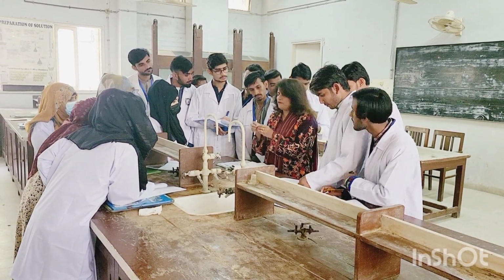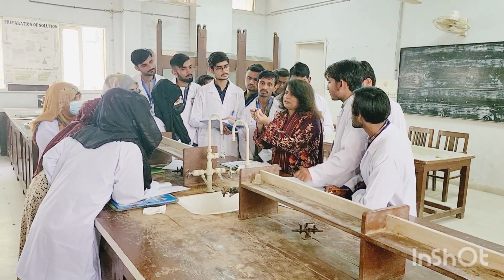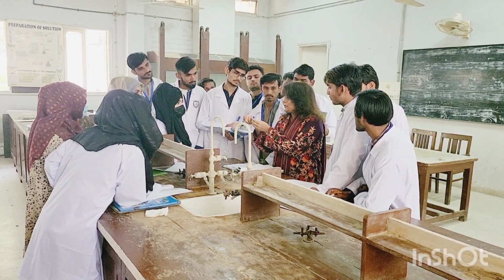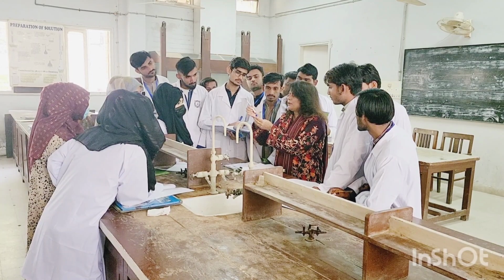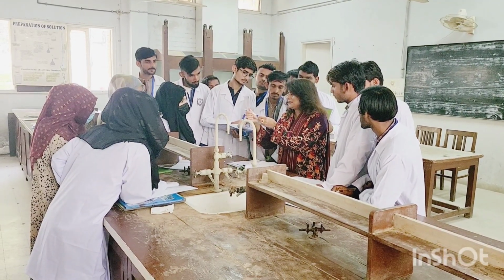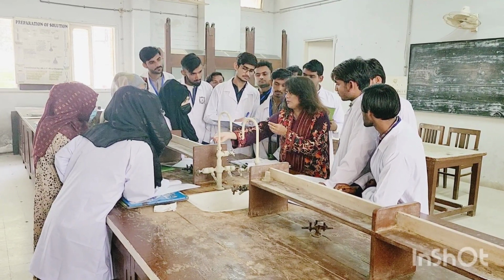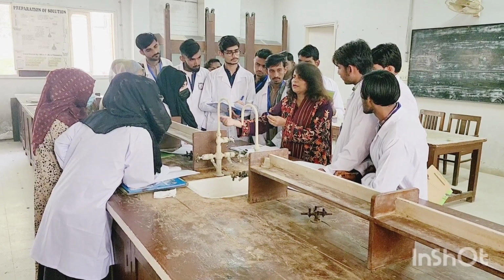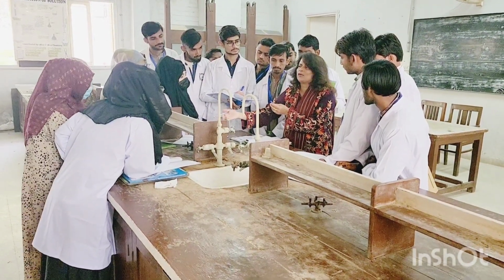Then what you are going to do, if this is a test tube, for example, and you have a litmus paper, right? It would be a blue or a red. You are going to insert it inside like this, and you are going to take it out and put it here somewhere, right? And wait for a few seconds. It will turn. If it's blue, it turns to red. If it's red, it turns to blue.